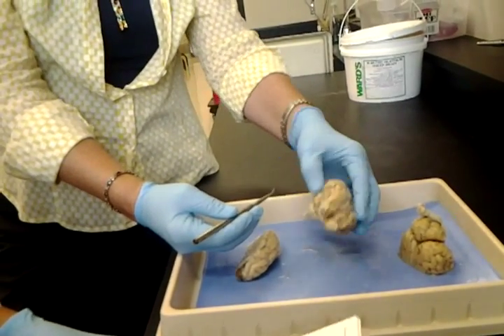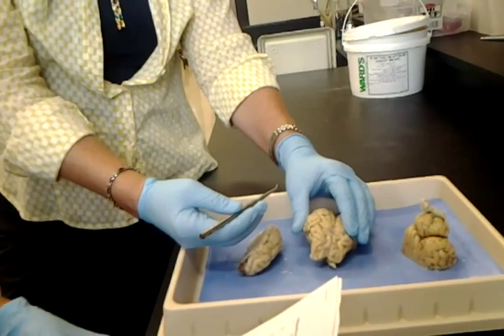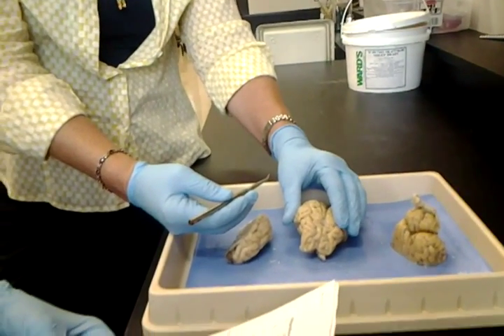Pineal gland. Is that on the... No, it's not listed on the sheet. We're down. We did pons.